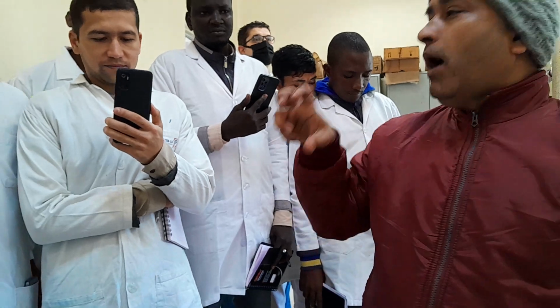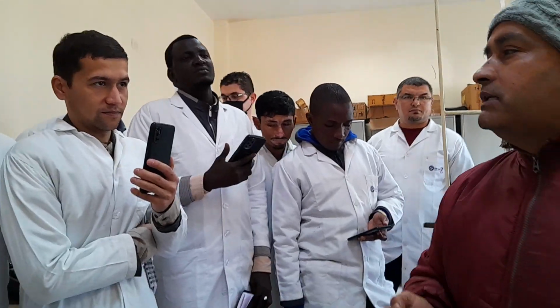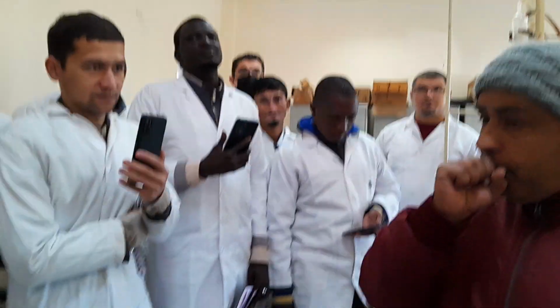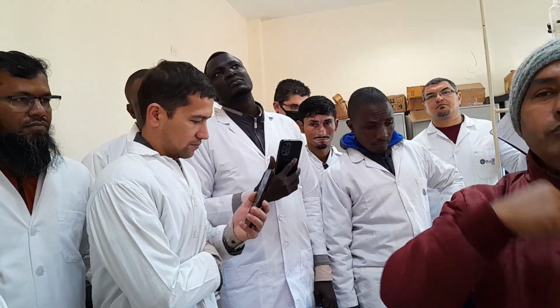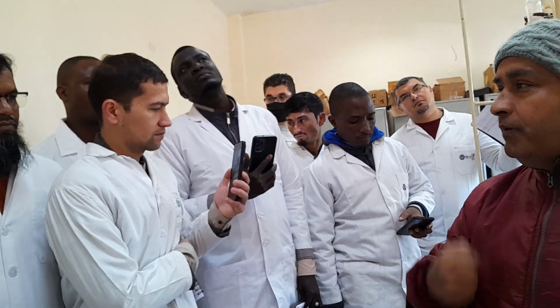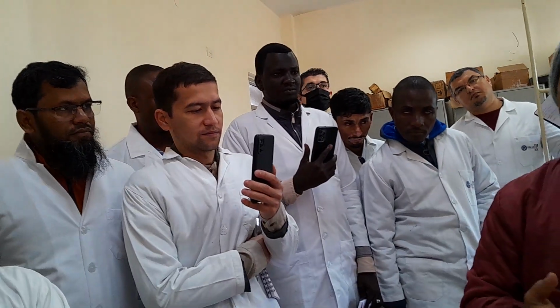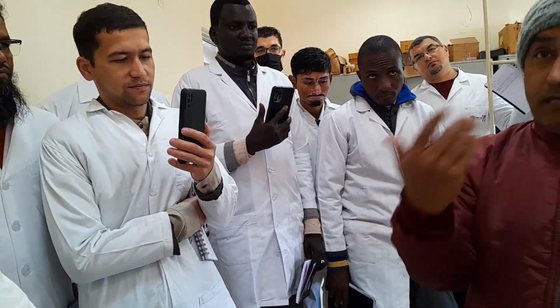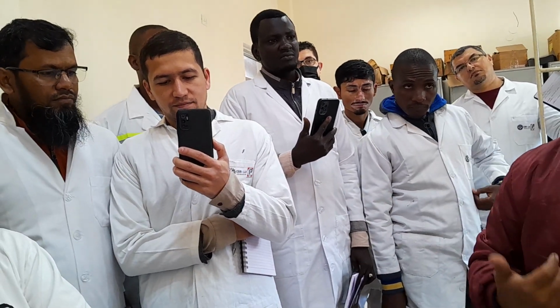That is why IIP is a government organization. See, IOCL, BPCL, HPCL, all these are limited companies. So the reports are more reliable coming from us. It is our duty to send the report in such a manner that there should not be any mistake. We will try to make sure there is no mistake. As I told you, 18 years have passed and I did not find any query from the refinery. If sometimes it happens, we definitely have to sort it out. It is our duty.